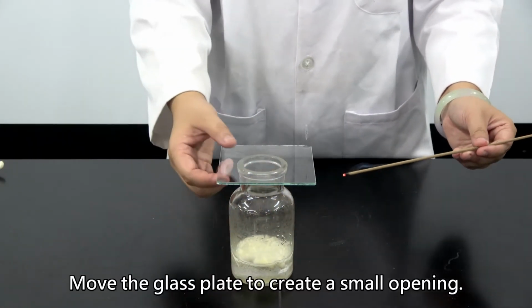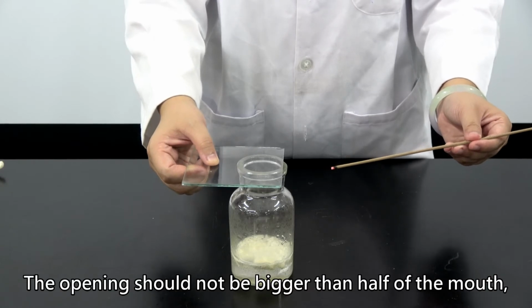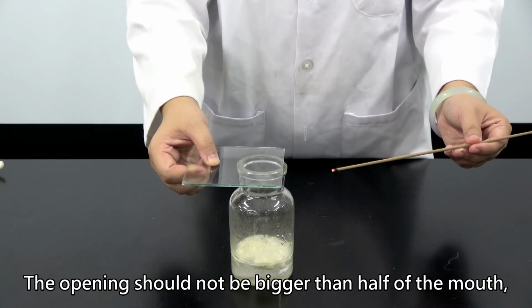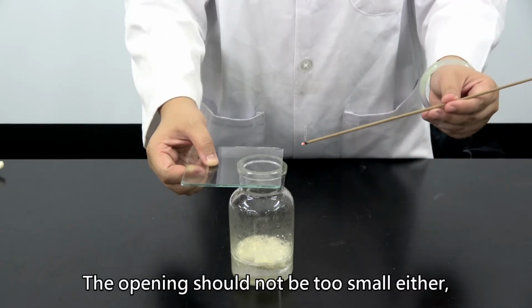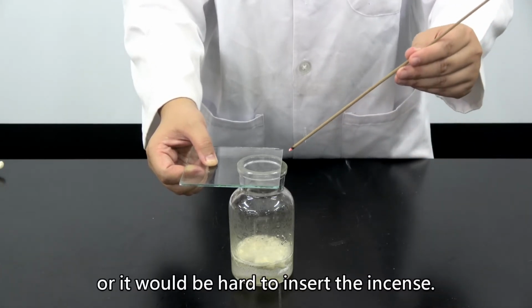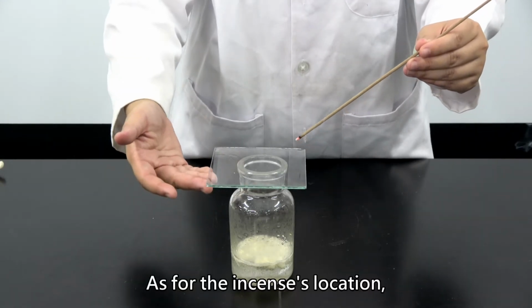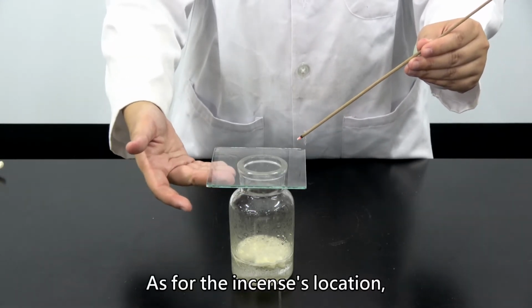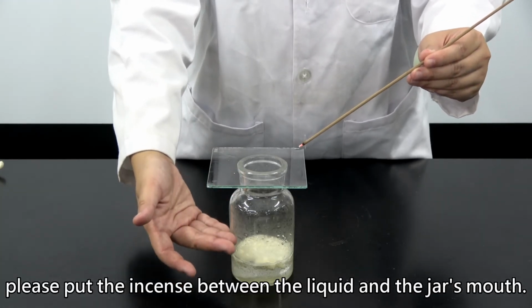Move the glass plate to create a small opening. The opening should not be bigger than half of the mouth, or the gas in the jar may escape. The opening should not be too small either, or it would be hard to insert the incense. As for the incense's location, please put the incense between the liquid and the jar's mouth.